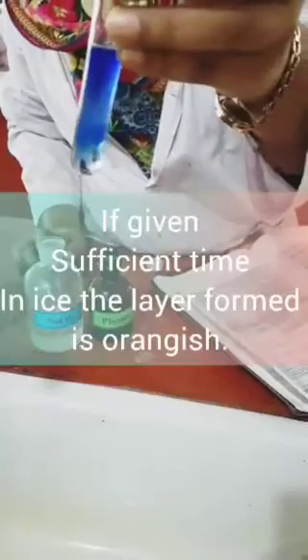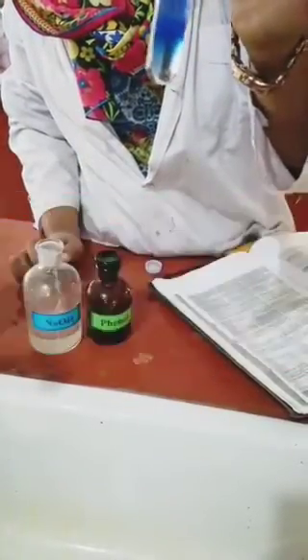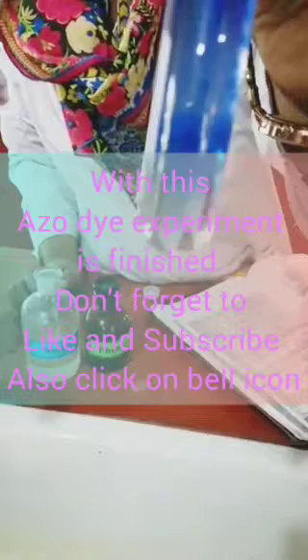Now I'm adding sodium hydroxide to it so that I can get the layer that is required, which will give me the identification that yes, I am dealing with phenol. See the layer that is being formed at the very end.